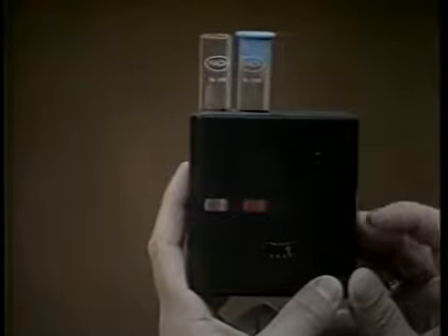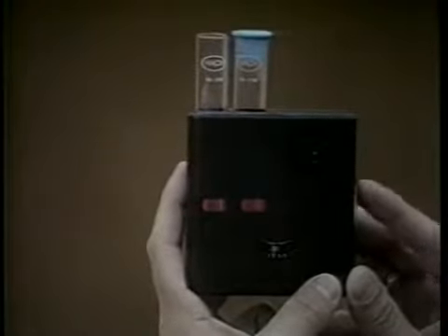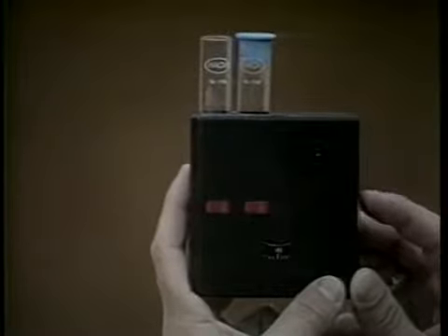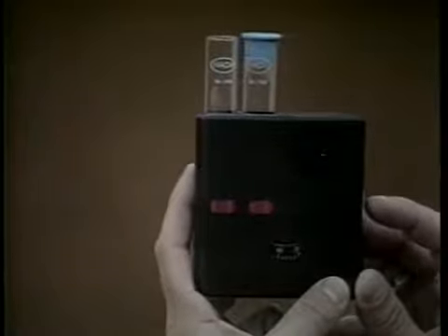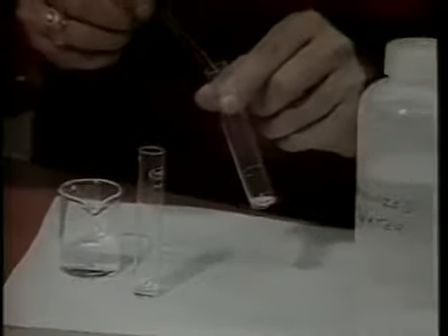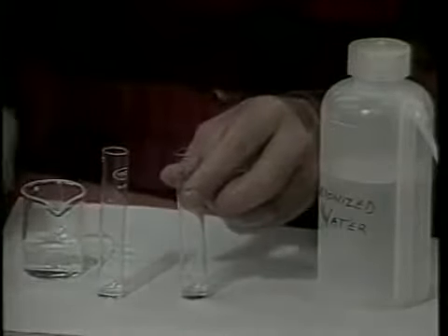If the reading on the wheel is greater than 0.45, or 90% of the maximum, a dilution of the sample is necessary so that the reading is within the color range which is detected by the color comparator. The same procedure which was used to dilute the sample when testing for ammonia is carried out so that the sample is diluted 5-fold.